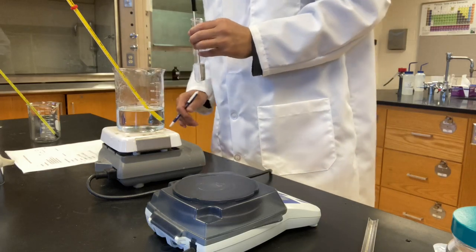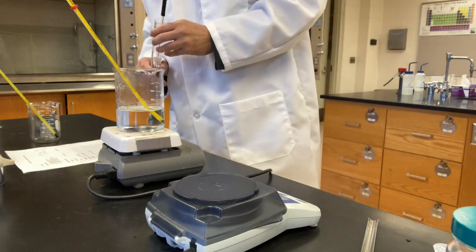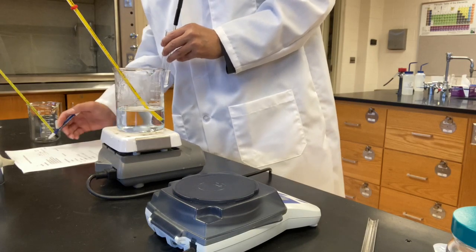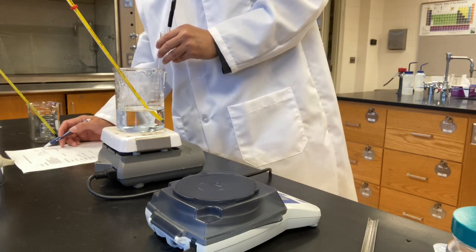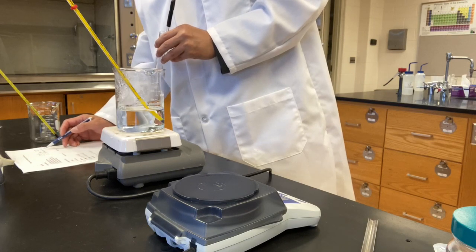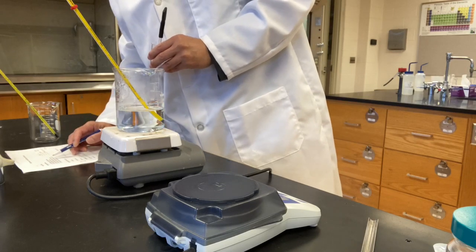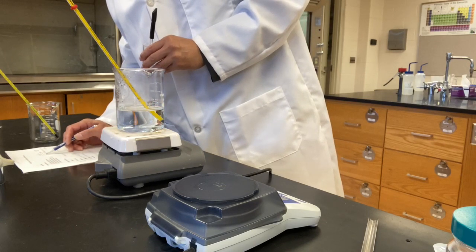Again, take a record of the amount of potassium nitrate added at 50 degrees Celsius. It is the sum of 2.173 and 2.244. You add these two numbers together and put it on line number 4.